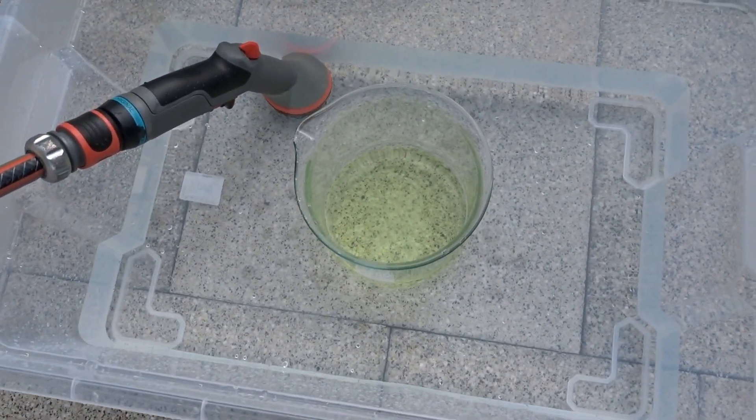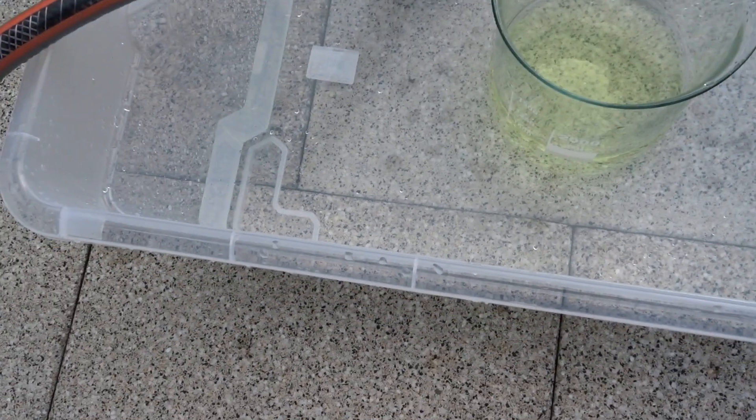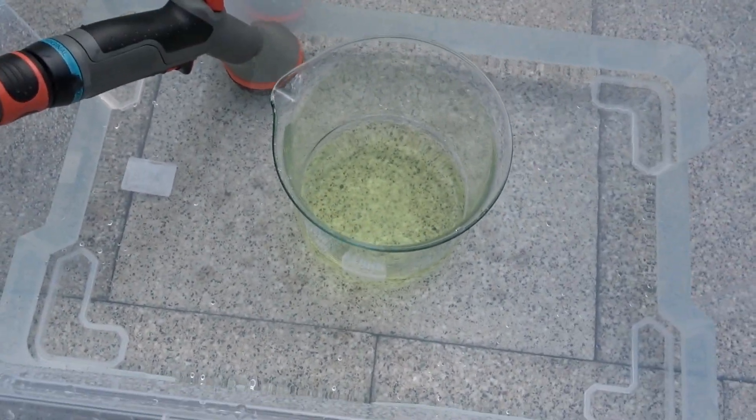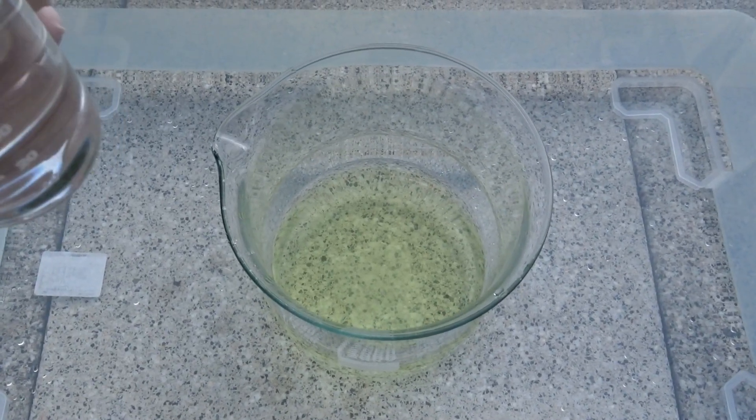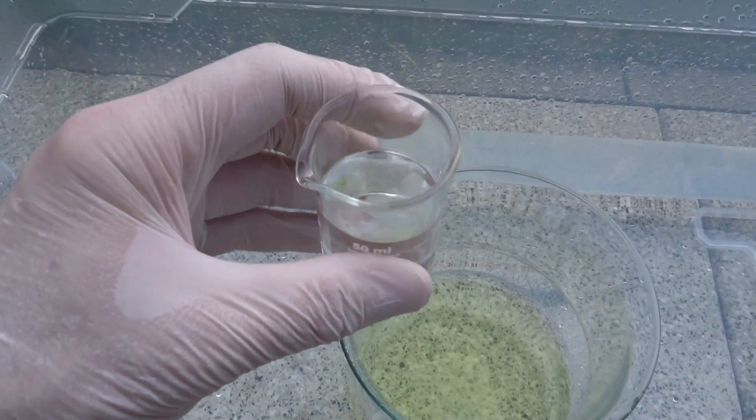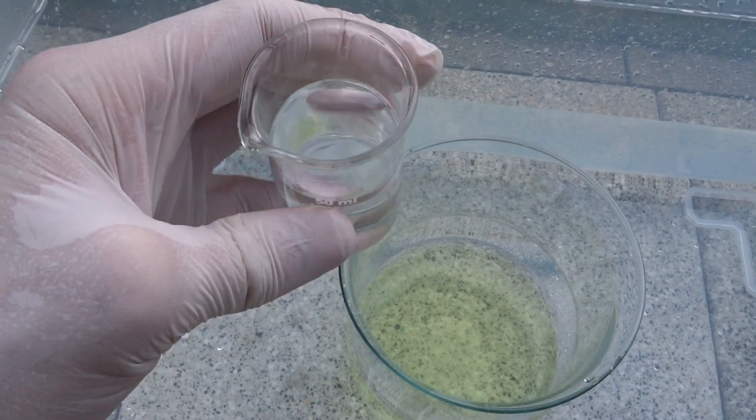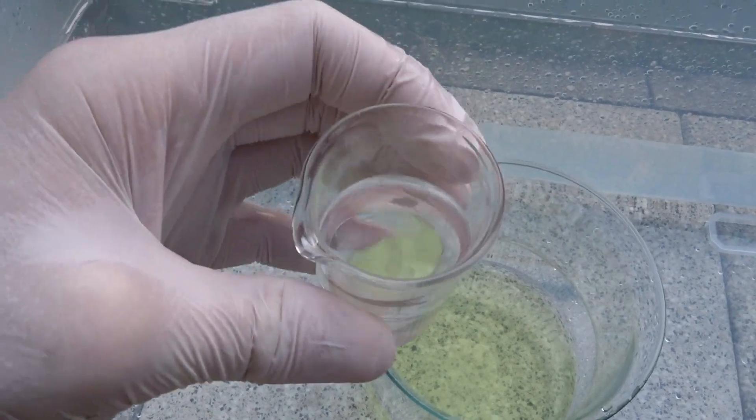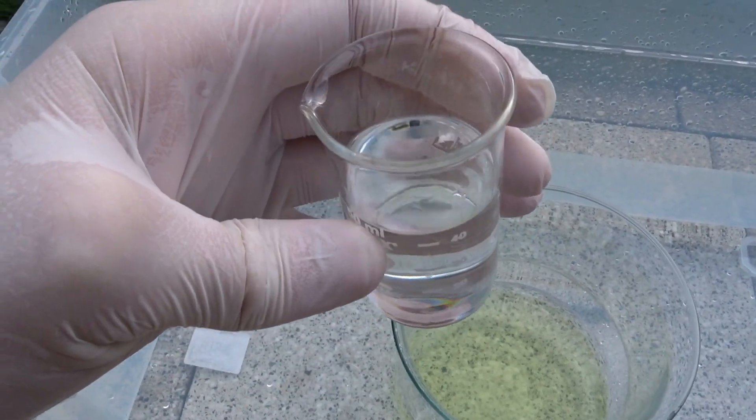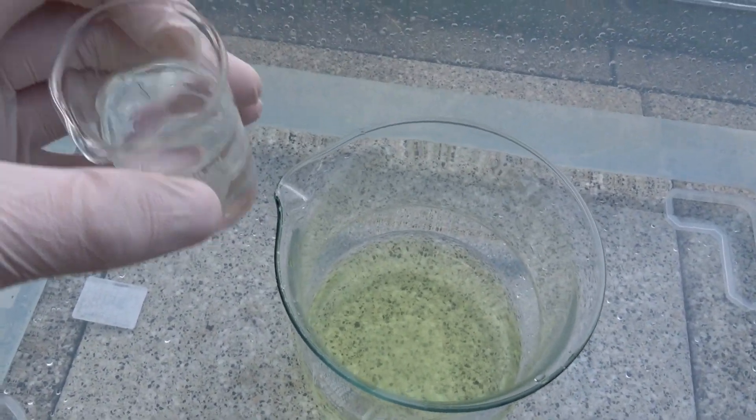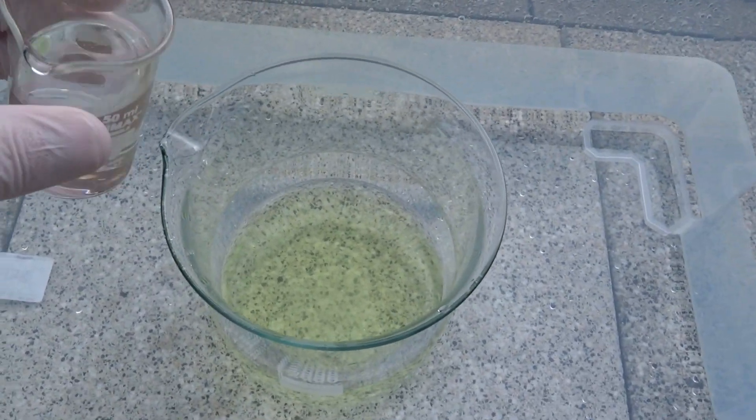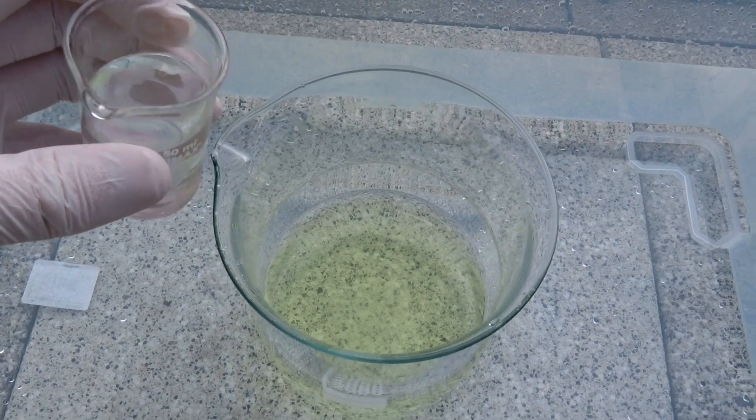To prevent vaporization loss, the cooling water is now added. In this beaker I have 35 grams, not milliliters, 35 grams of acetone. So it's roughly around 40, but more than 40 mL. But go just with 35 grams. I'm going to add this and then start stirring.